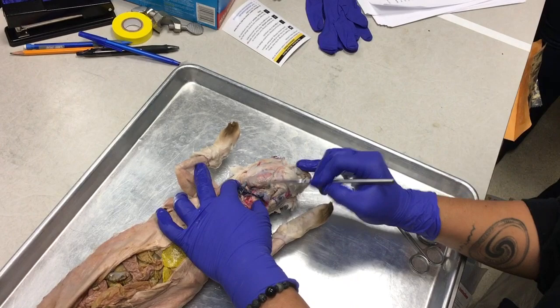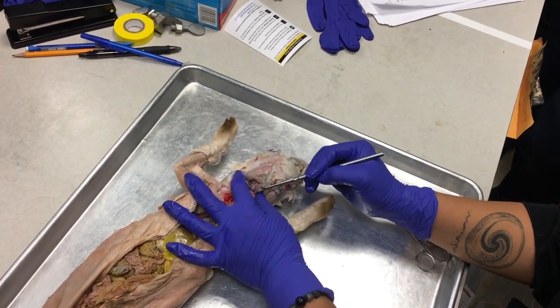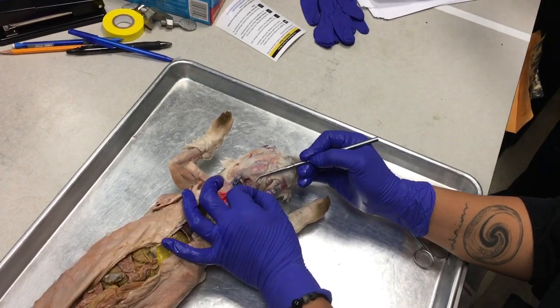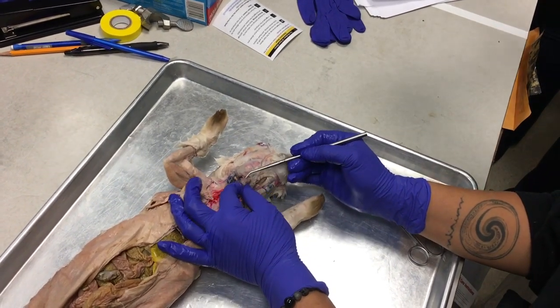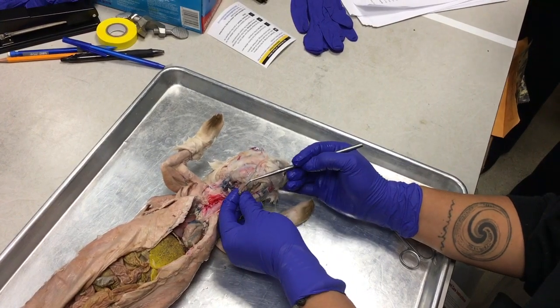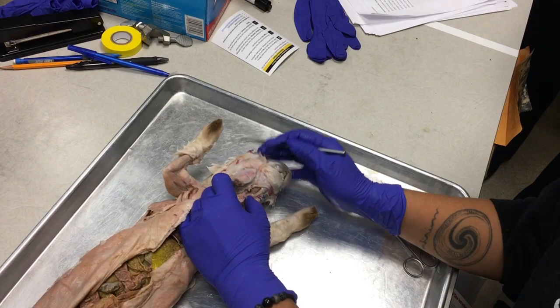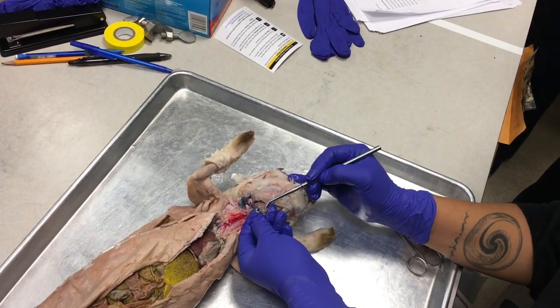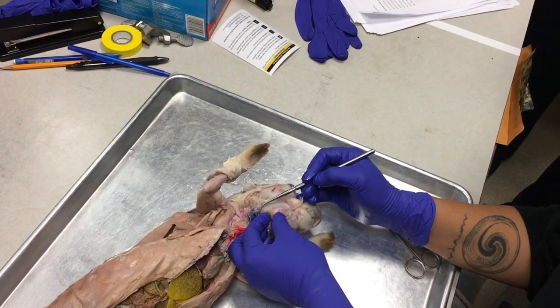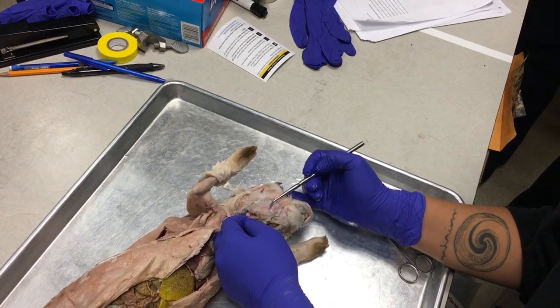And then if you dig on the ventral side of the masseter muscle, you're going to dig up these big lobey grayish brown things, okay? These are salivary glands. All of these grayish brown chunky tissues are salivary glands.